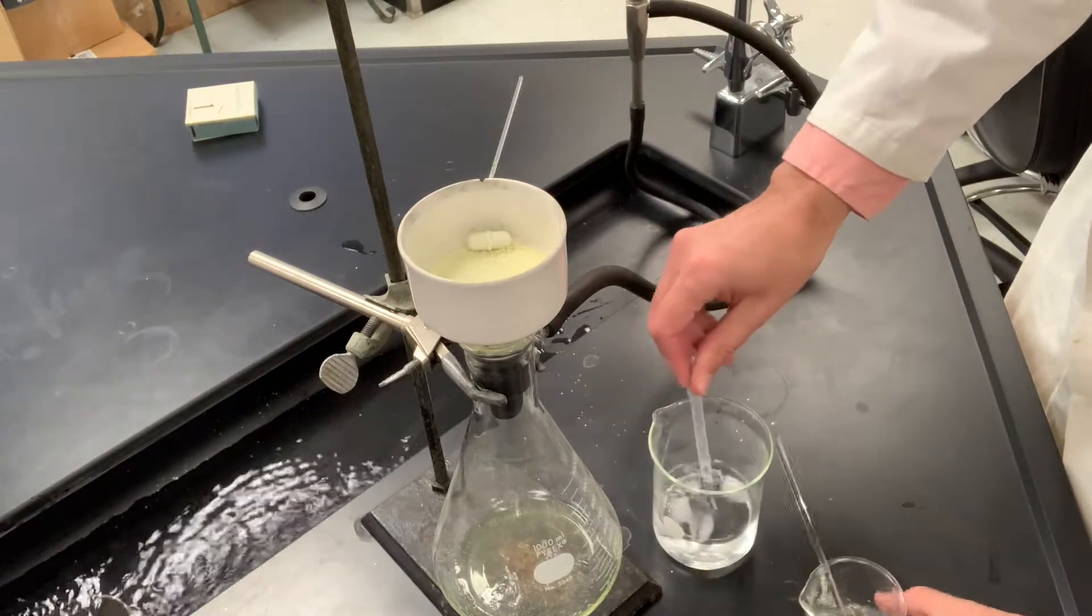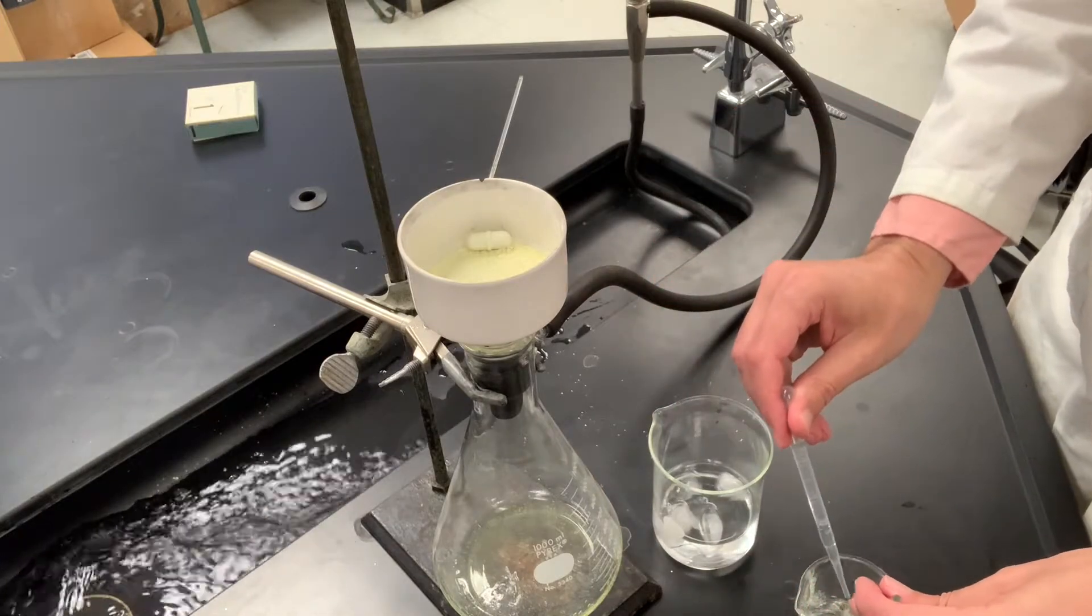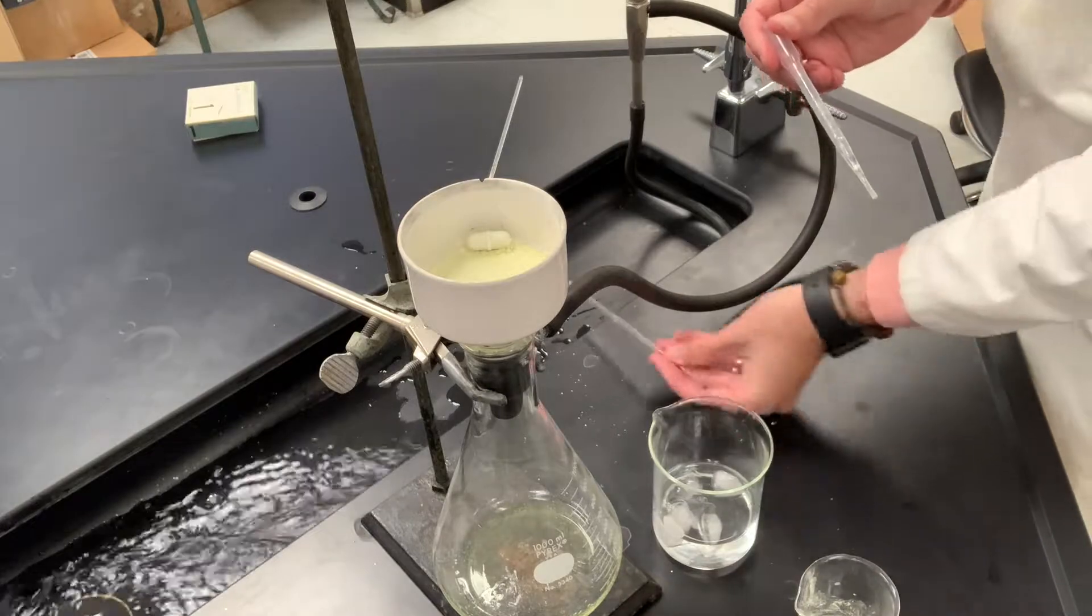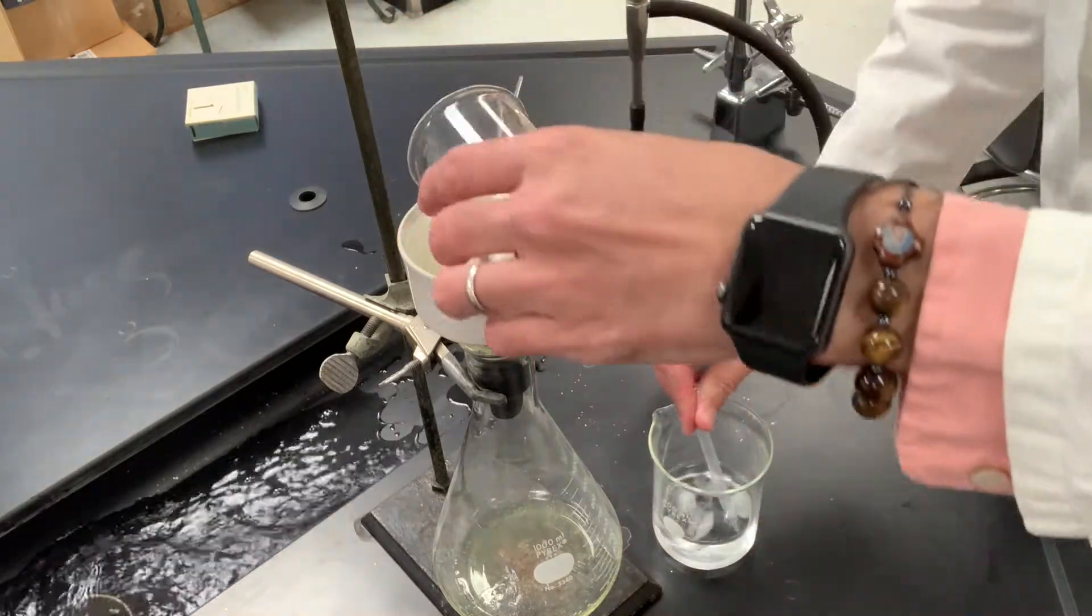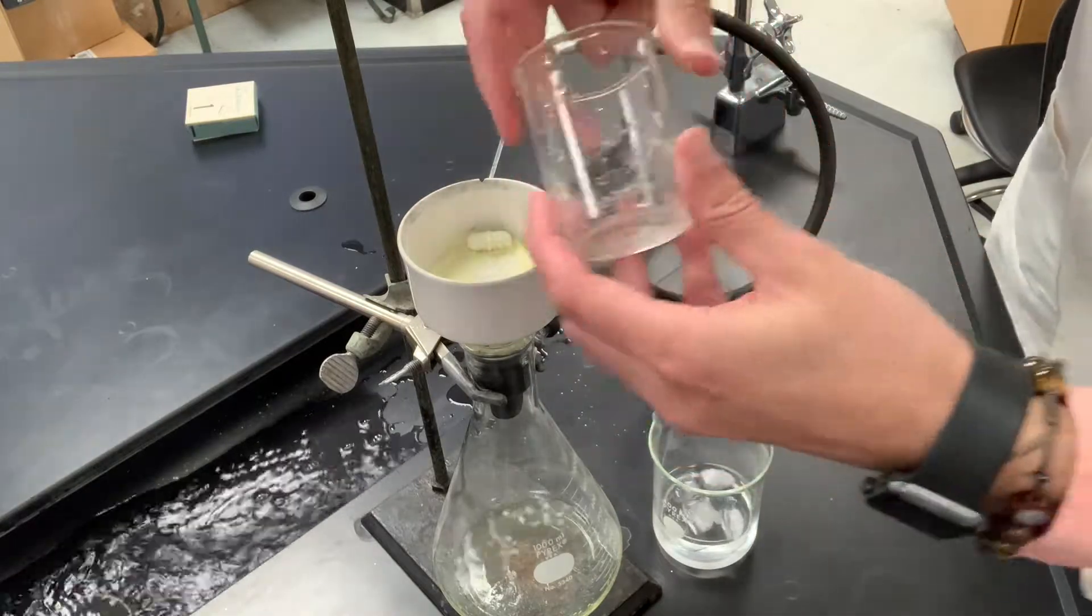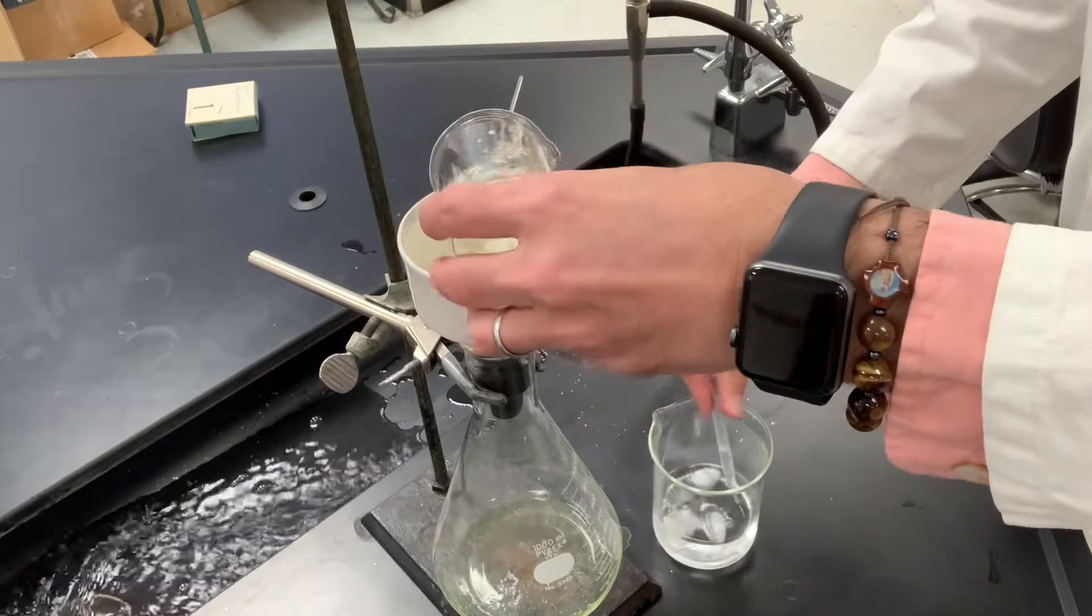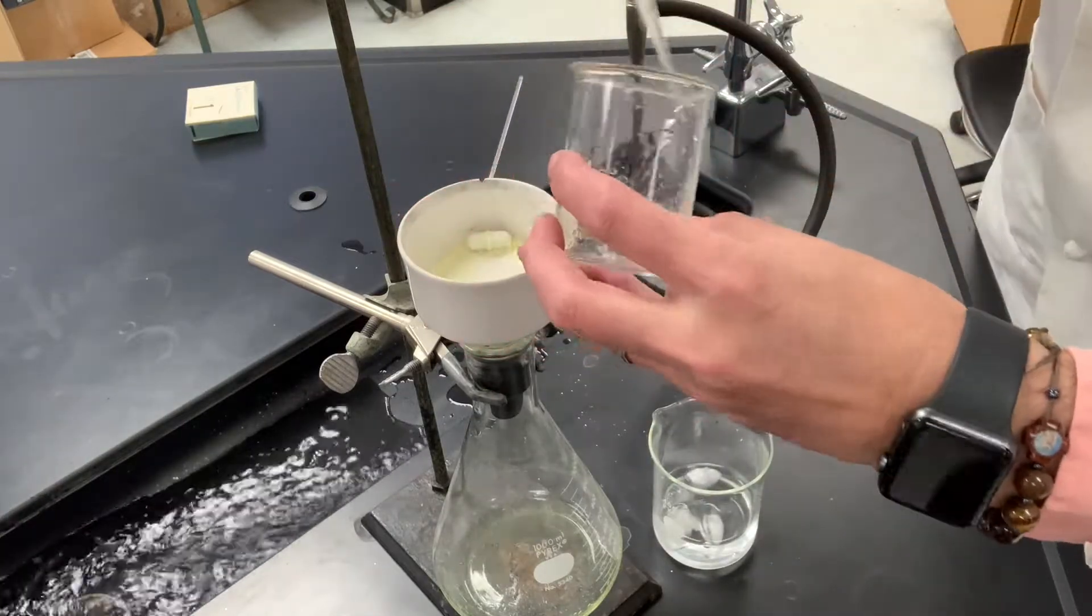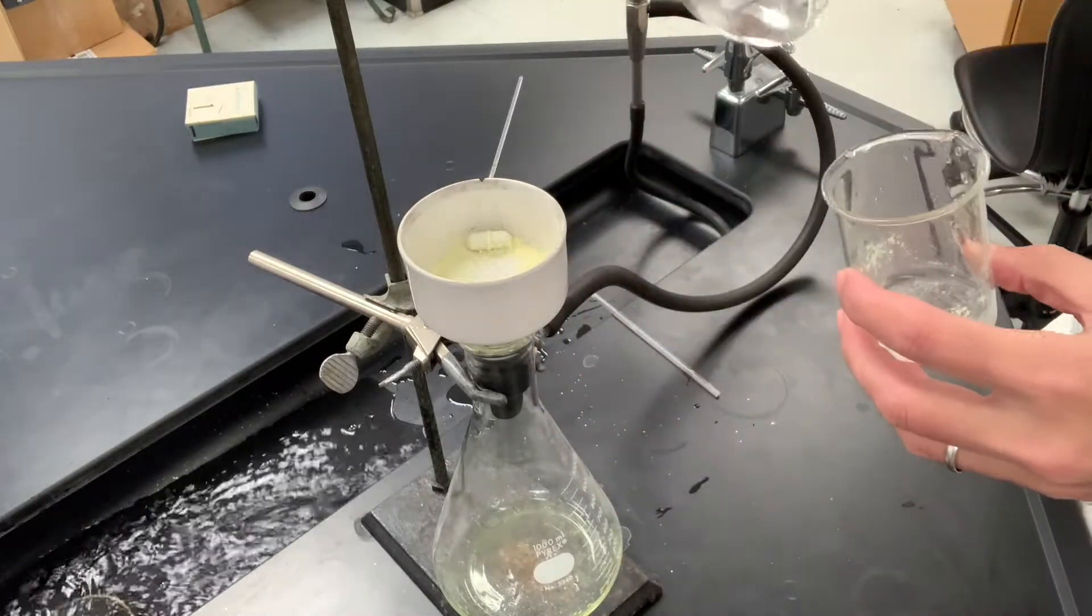Use some ice-cold water here to rinse our equipment. Rinse the sides of the flask there. This is ice-cold water, still got the ice cubes in there.